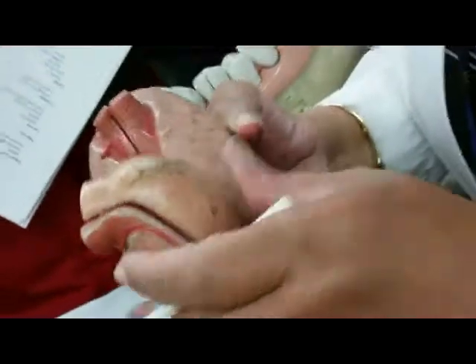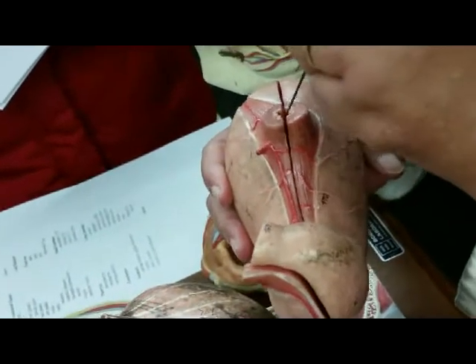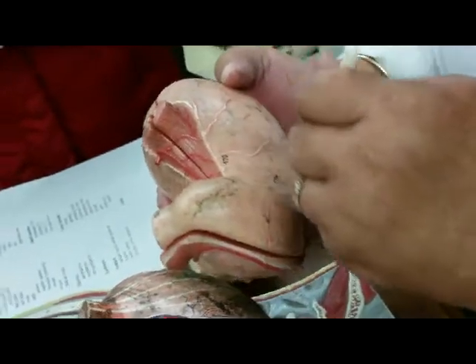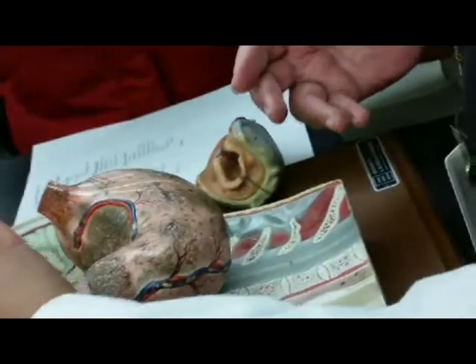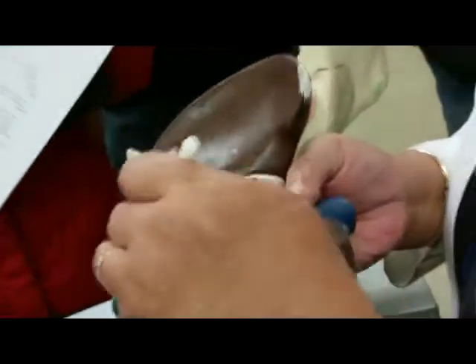This is much better because you can see it a little cleaner. It's cleaner. Here is the cardiac region, the cardiac sphincter, the fundus. Here is the body and the pylorus and the pyloric sphincter. We're not going to go in. And this is the gallbladder in green, because the bile salts are green. So again, the liver, not going to ask about the lobes, gallbladder.